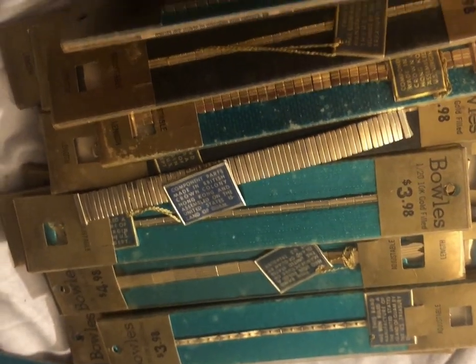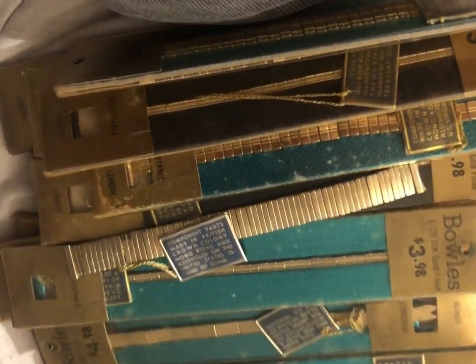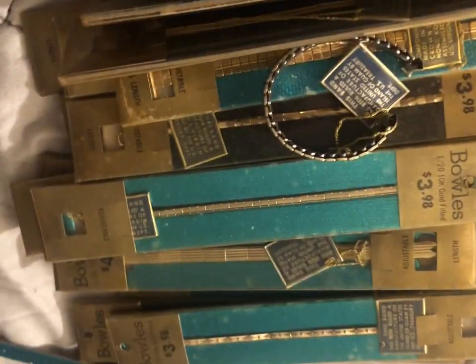I'll get these weighed up and let you know what they weigh. Then we're going to start removing these little gold caps. So the total weight is 160.63 grams — I did tare out the plastic cup. That's a pretty good deal; I got a really good buy off eBay. I might actually make money off of this, so we'll see.